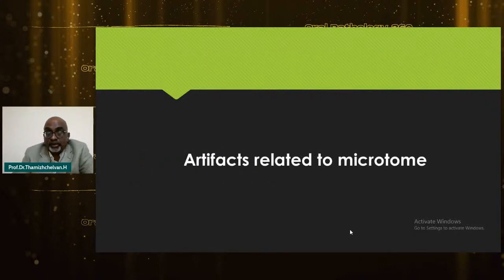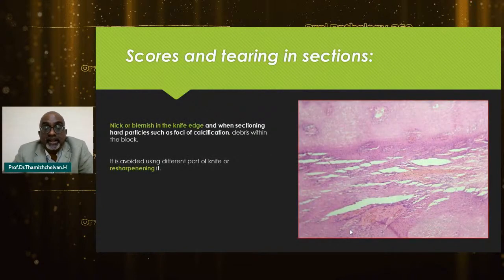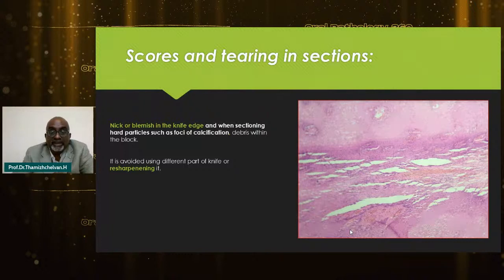Then it comes to the microtome, the artifacts related to the microtome. Usually the problem was a little higher when they were using knives. Now, after the disposable knives came, it started coming down. These were the nicks and blemishes when your knives were like a barber shop's. When we were doing our postgraduate, we had this difficulty because you will have a lot of foci of calcification. And I'm very sure seniors will admit how comfortable the younger generation is now with the disposable blades.